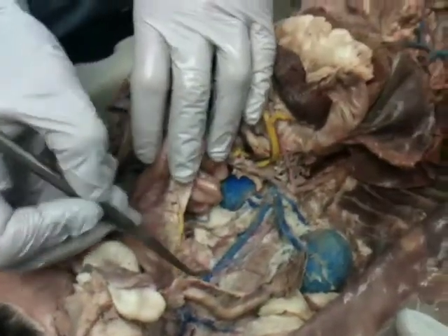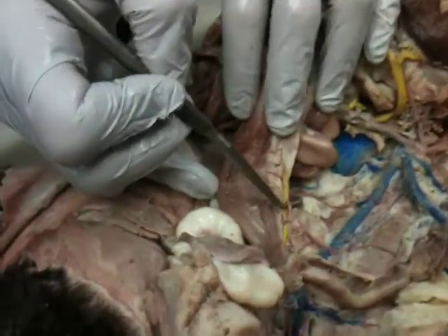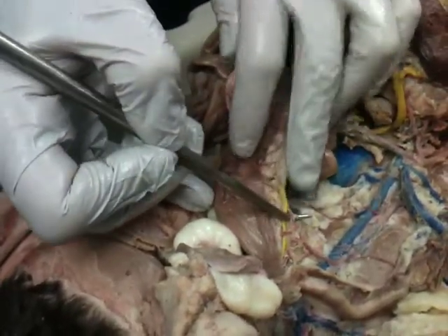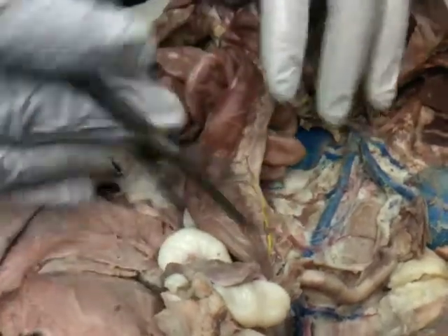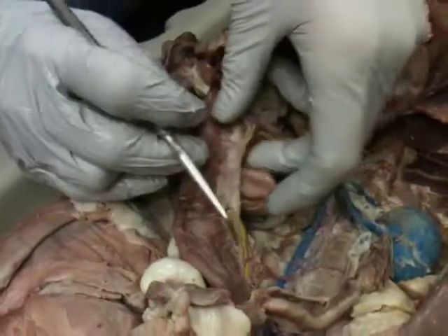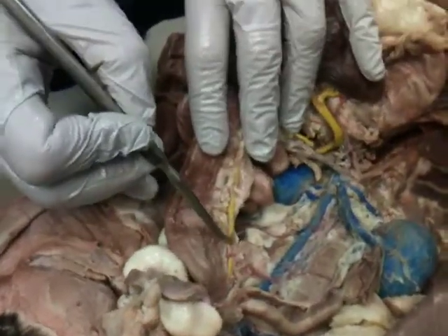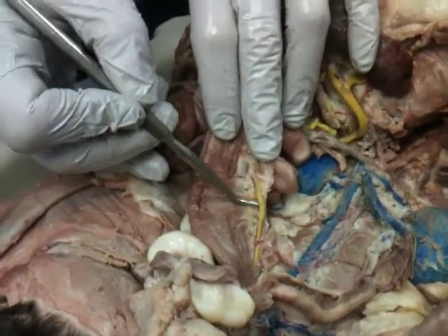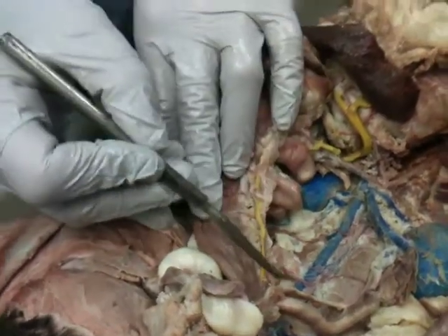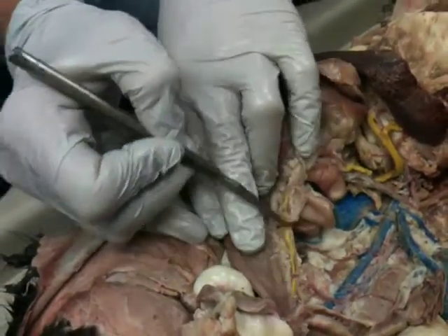So this inferior mesenteric artery, when it divides, this section here, going to the colon here, is known as the left colic artery. Again, all of this is kind of over that way, so it is the left side, even though we have it flipped over here. So this is showing that left colic artery, and actually the left colic vein runs right along with it. Now, this is going to divide, left colic artery and vein over here.